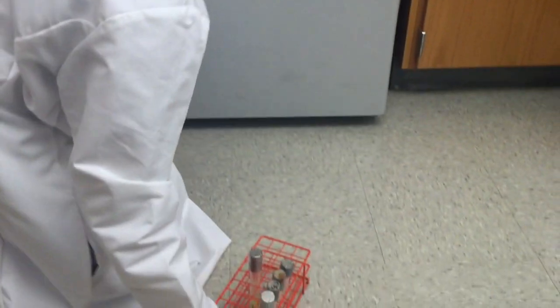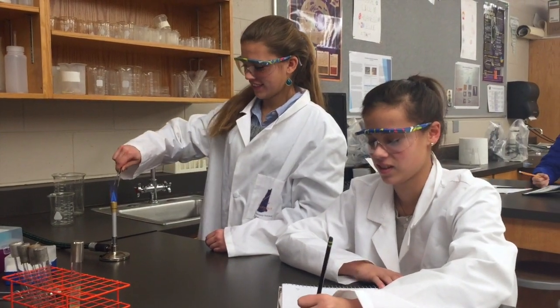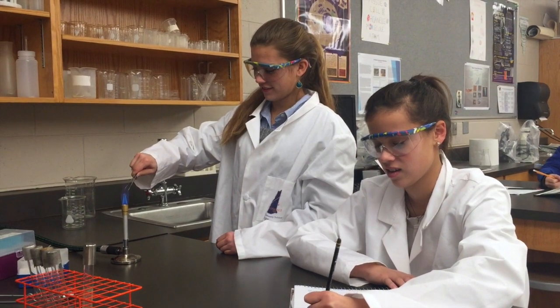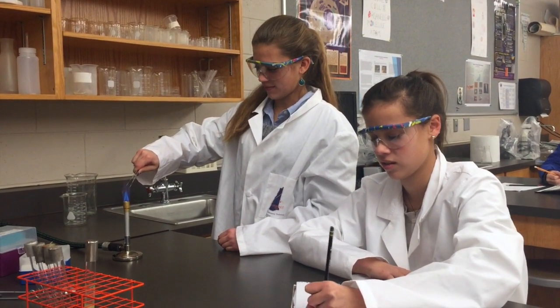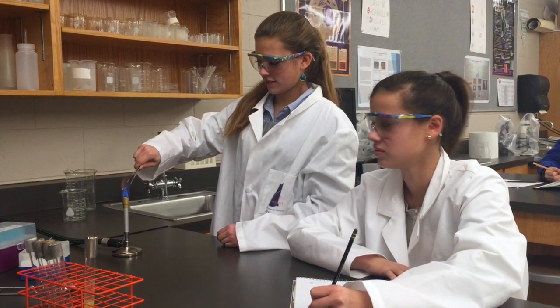These tubes should then be brought back over to your lab bench so you can complete the bead transfers. As described previously, your forceps are held into the flame of a Bunsen burner and held there until the tips of the forceps get red hot. Now that these forceps are sterile, make sure they do not come in contact with anything until after the bead has been transferred as sterilely as possible into the new media tube.